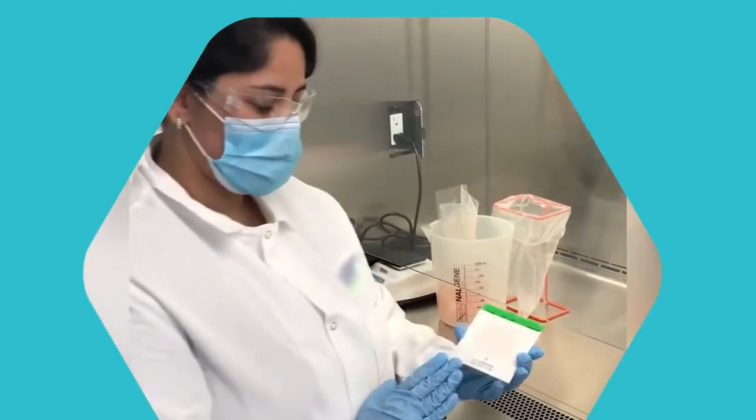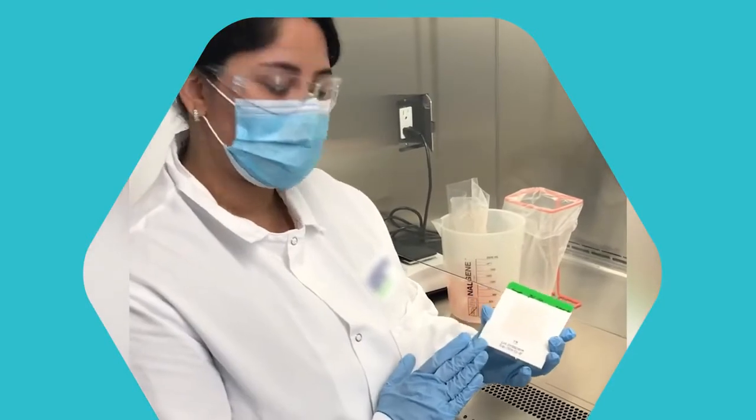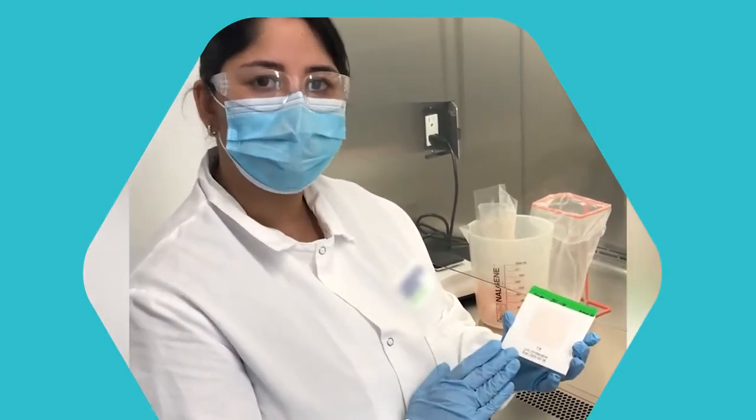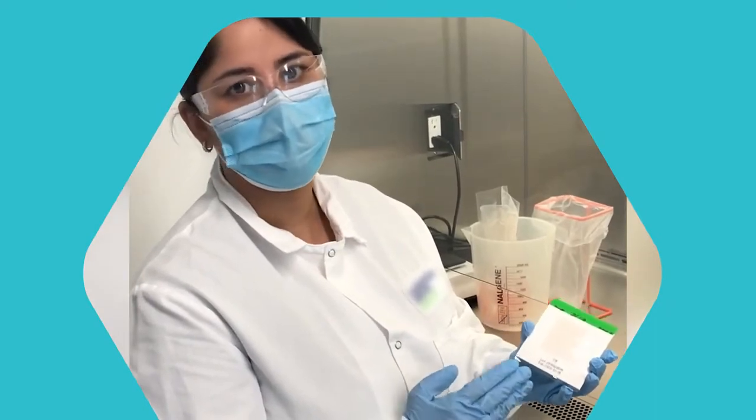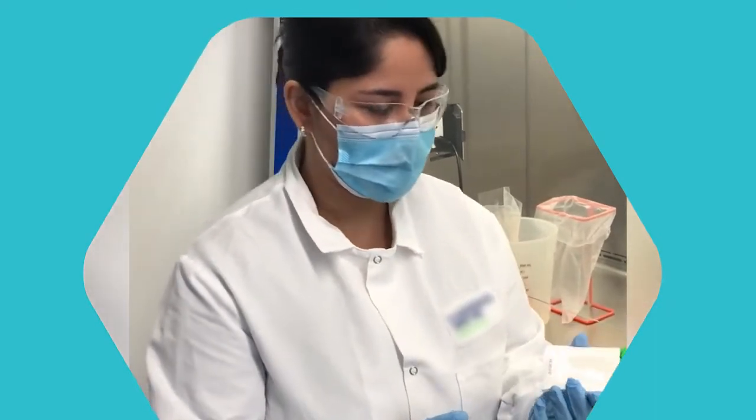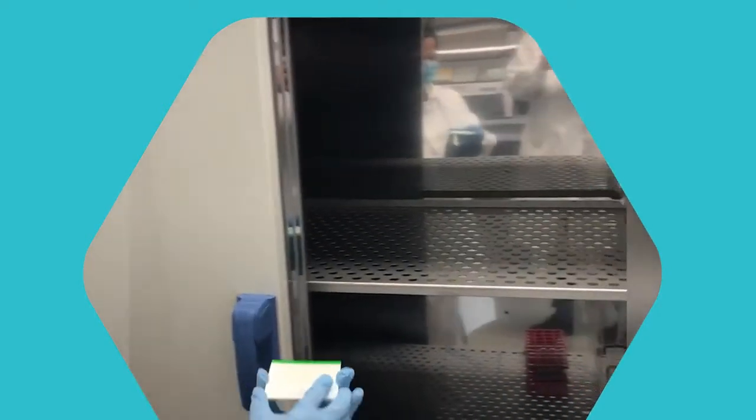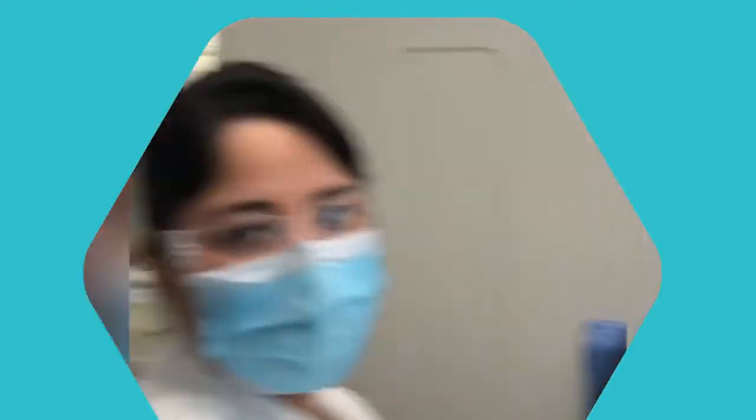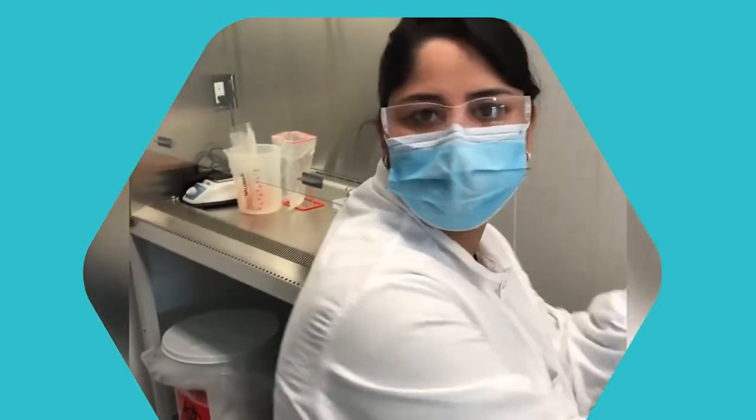So now we have these pads to test for yeast and mold. They're going to get incubated for two to three days, 48 to 72 hours. And we're going to put this in the incubator. They can just get stacked on top of each other like this. After 48 to 72 hours, we'll come back and take this out and show you the growth.